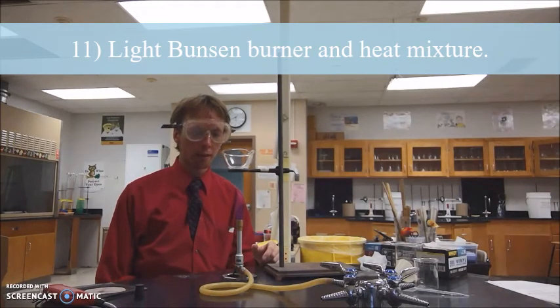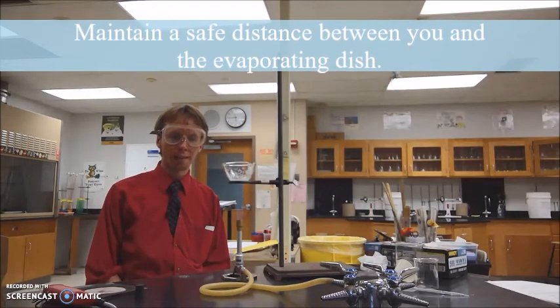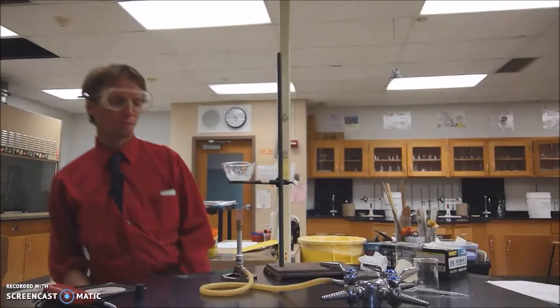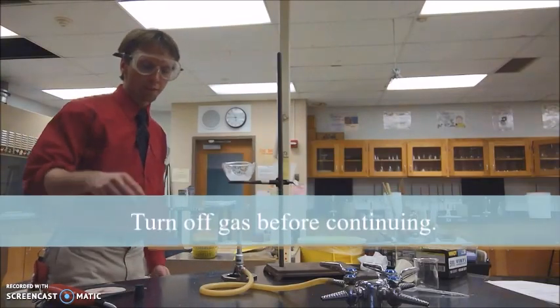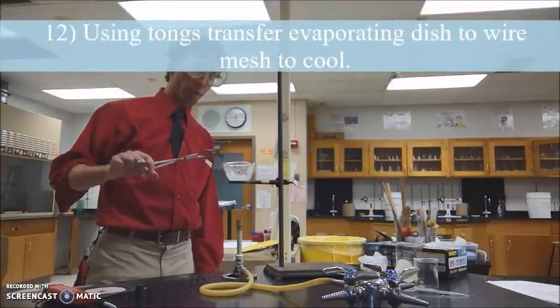You'll sit back and wait until the water completely boils and see if you have anything left over. As you get towards the end of your boiling, some of the material may splatter, so just make sure that you're a safe distance away. Once the water is mostly boiled off, you'll turn off the gas, and you should have something left over in your evaporating dish.